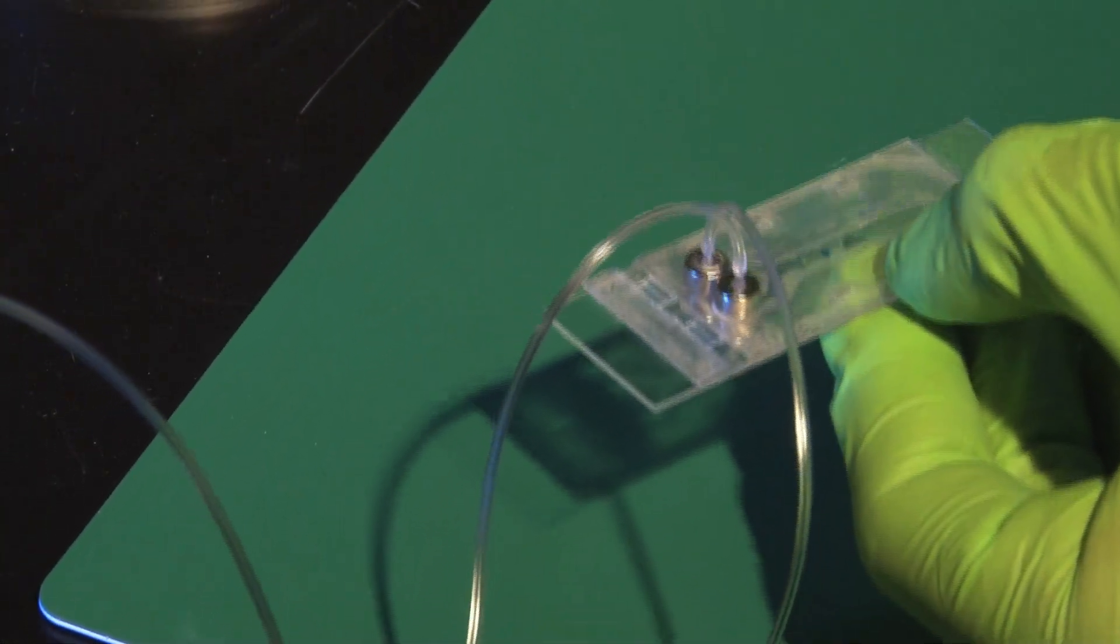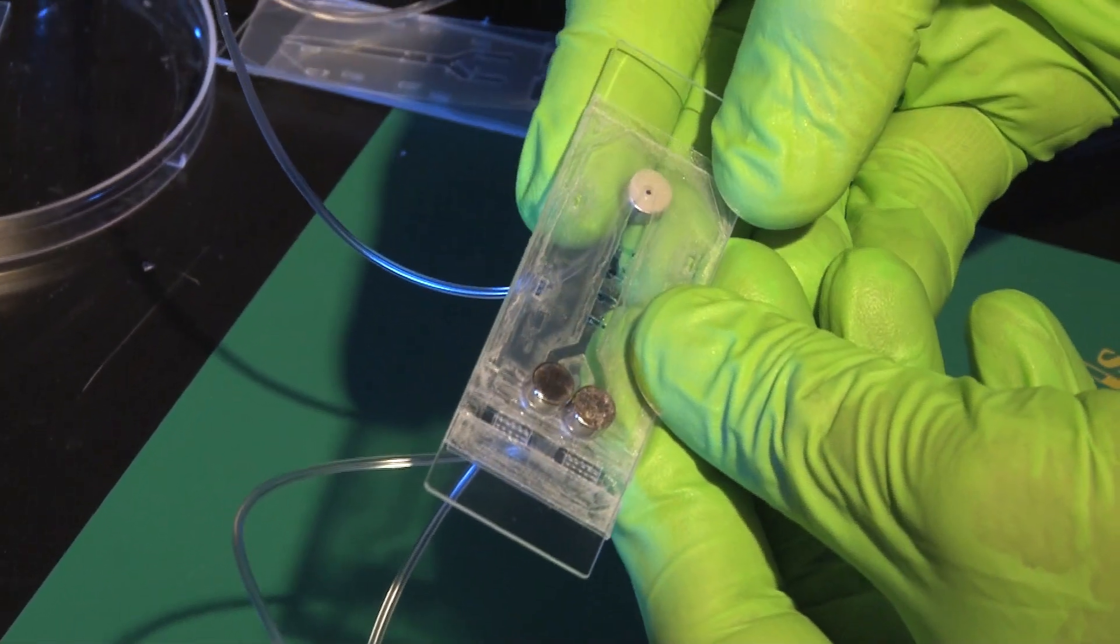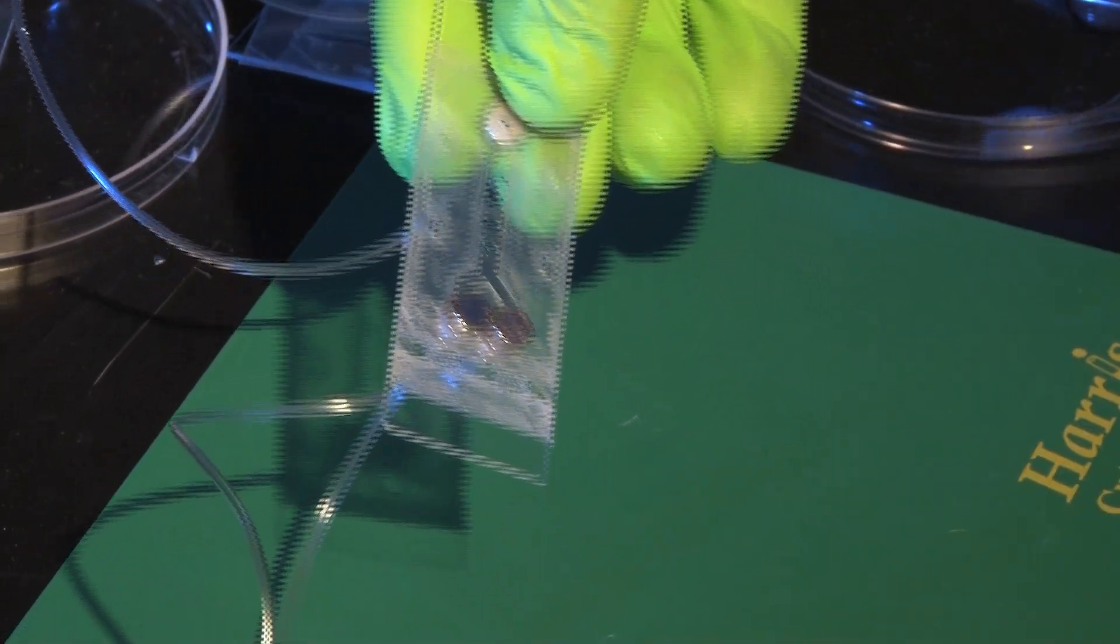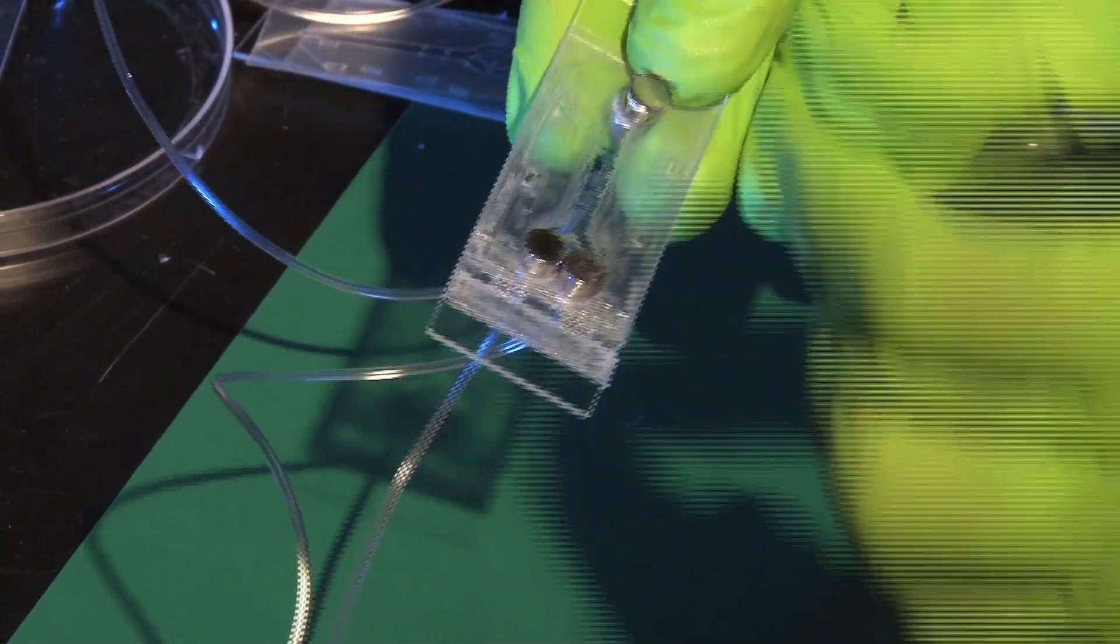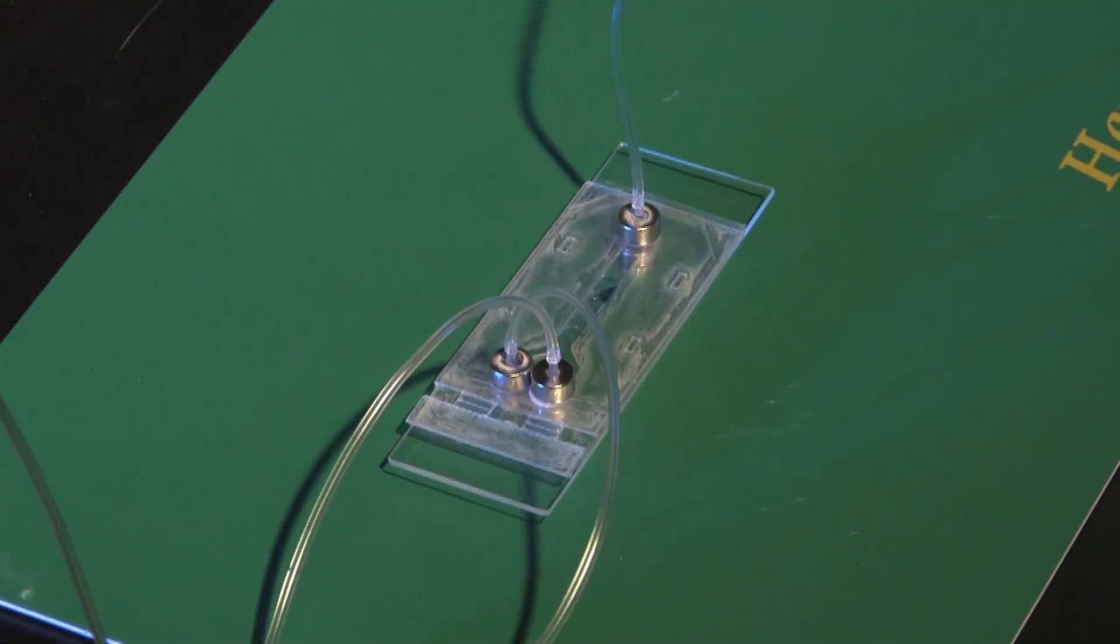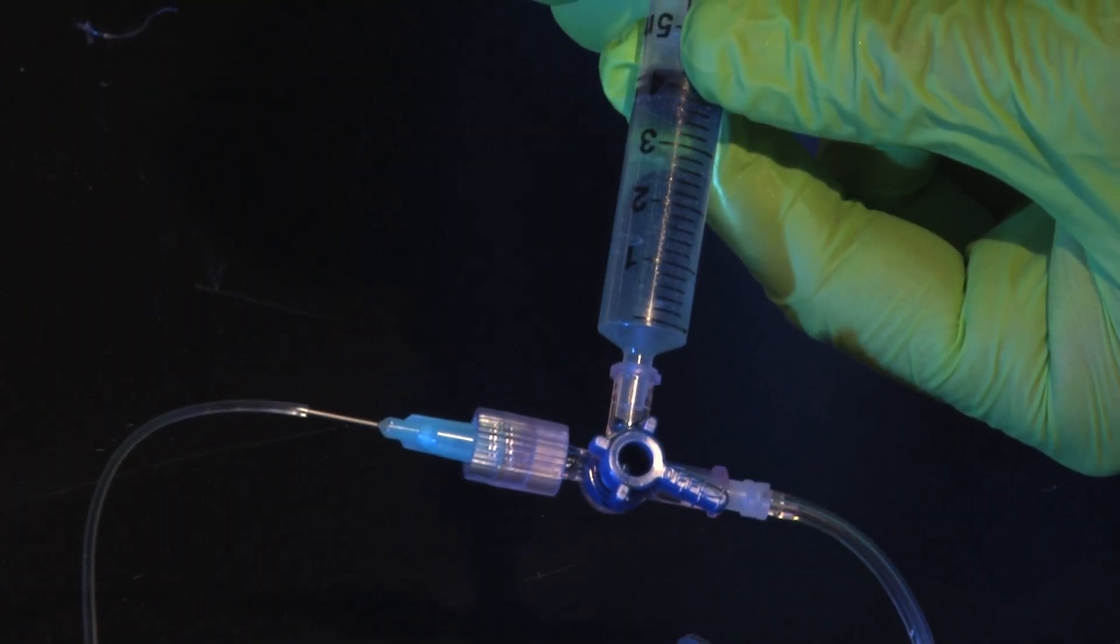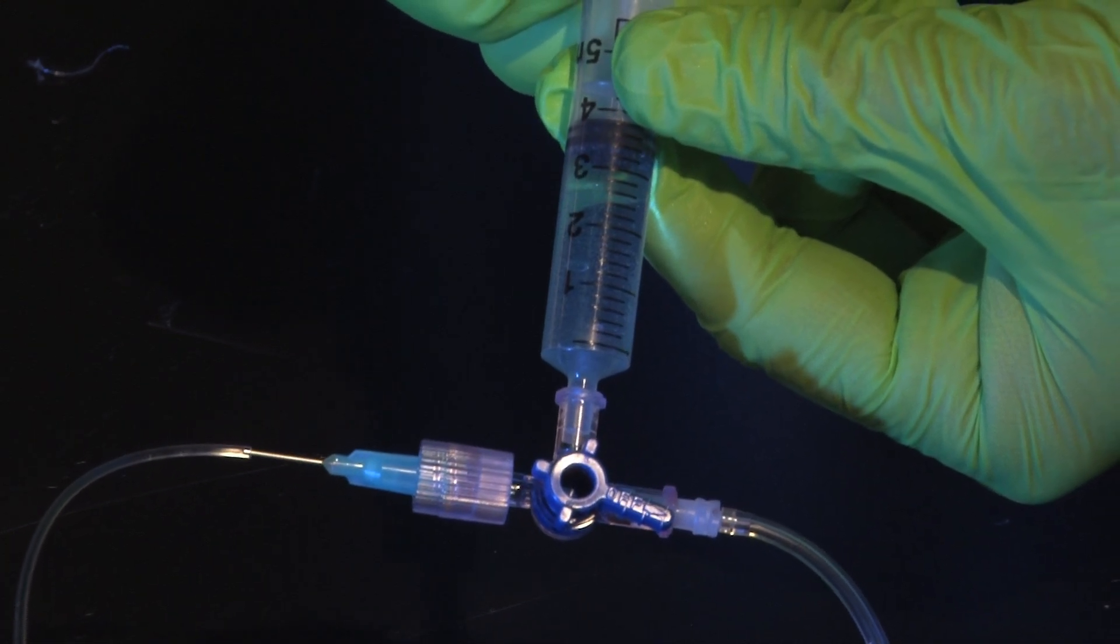And then on the other side the same. At this point I can start pumping in liquid. There it is.